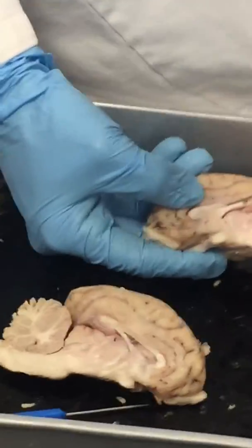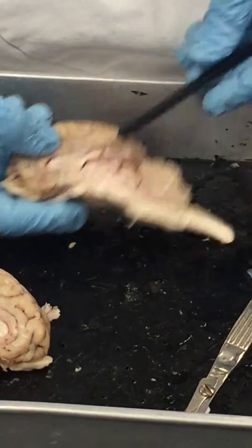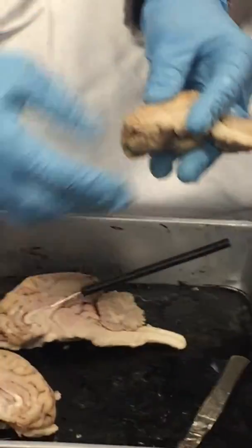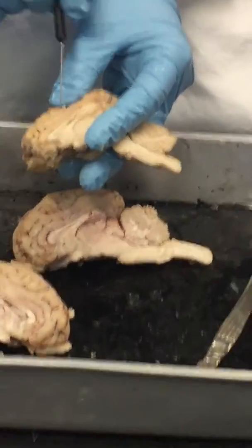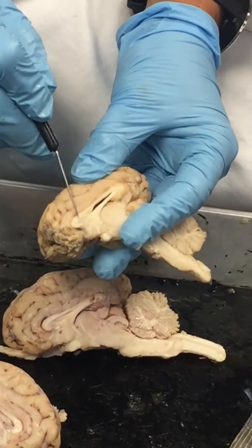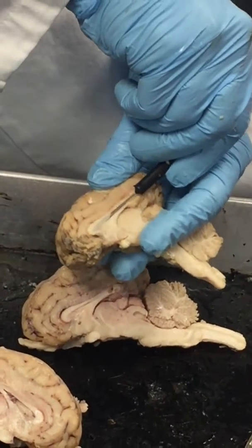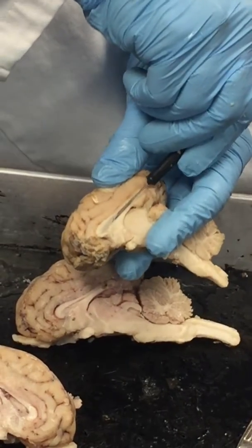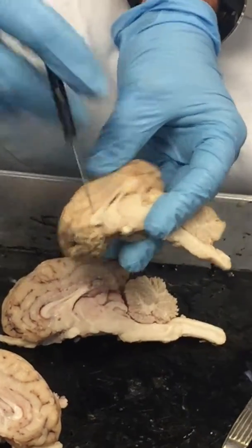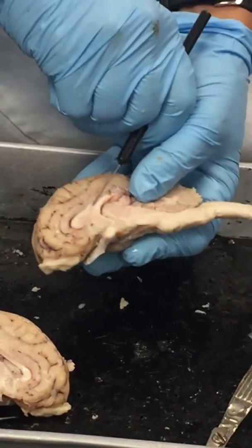When you do a cross section or a mid-sagittal section like this, you're only going to see it on the one side. So you can see it here. I think on this one, you can see this space here, but you can see that septum pellucidum right in this area, right? So that real thin layer of that septum pellucidum right there kind of covers that ventricle up, okay? So this one is nice because it's a little thicker on both sides.